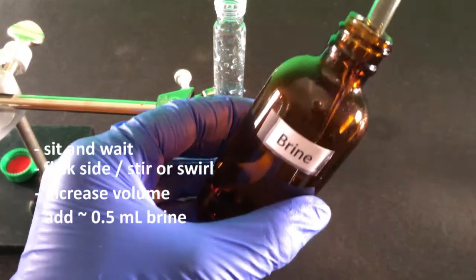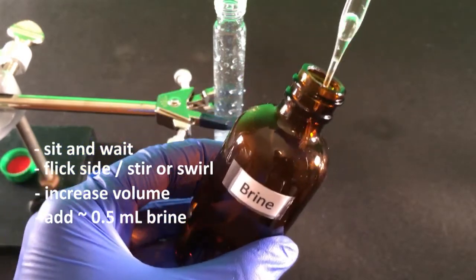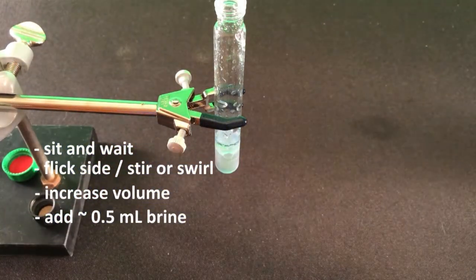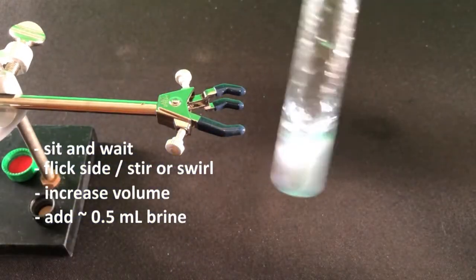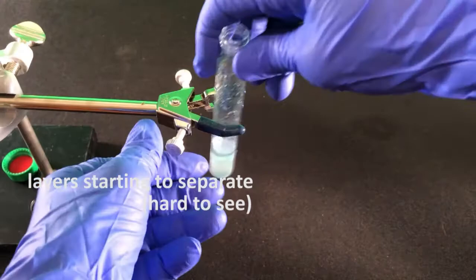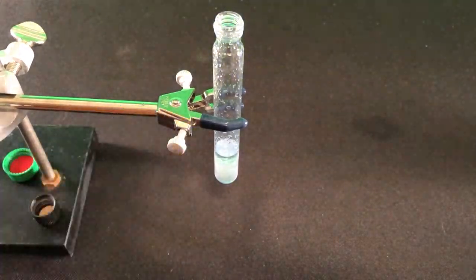Add approximately 1/2 ml and swirl. The sodium chloride increases the ionic strength of the aqueous layer and decreases the solubility of the organic solvent in the water. The salt essentially pushes out the organics from the aqueous layer.